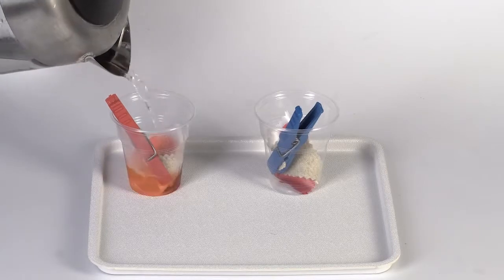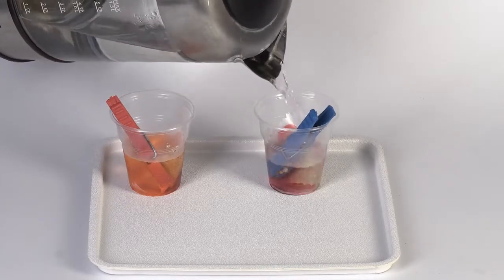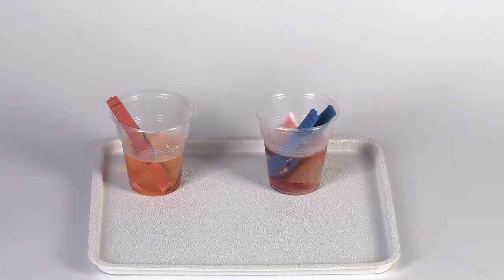Carefully pour boiling water into the cups to cover the pieces of fabric. Wait for 10 minutes.